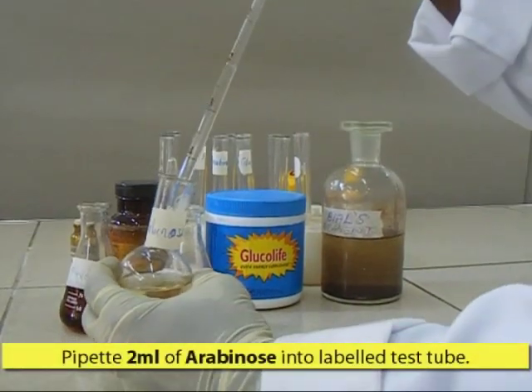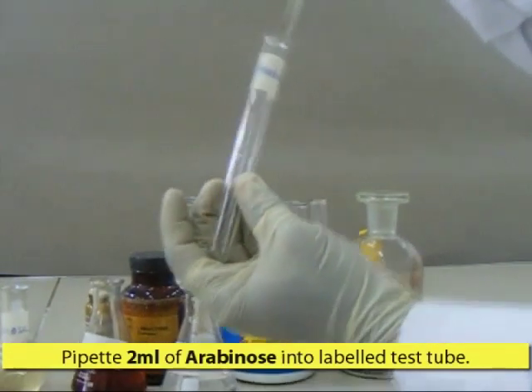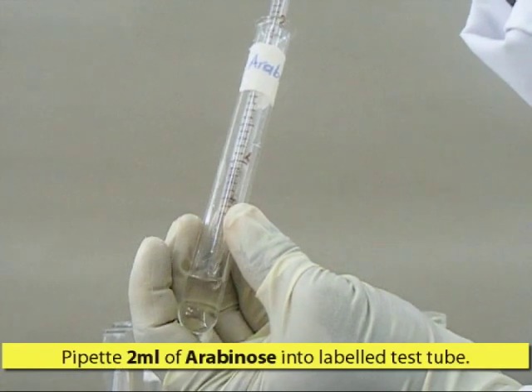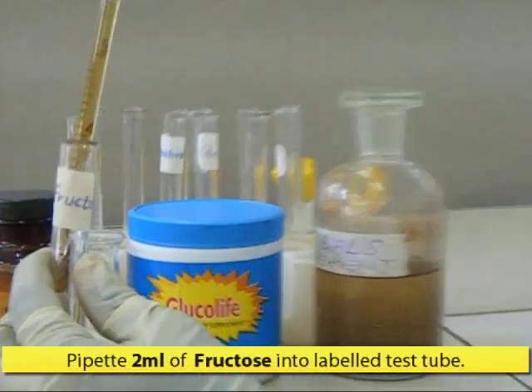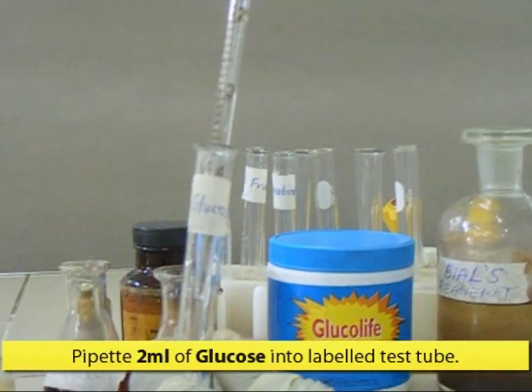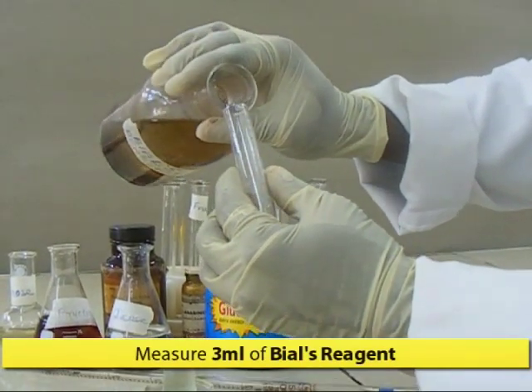Pipette 2 ml of each test solution into labeled test tubes. Add 3 ml of Bial's Reagent to each test tube.